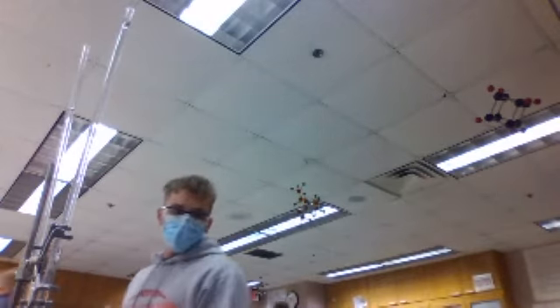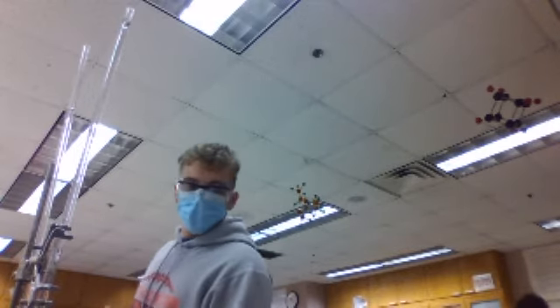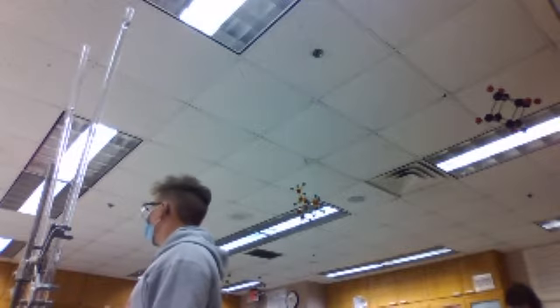That's why we use these. That's why they cost $120, guys. You can't tell me you're at 0 or 1. You have to tell me 1.12 or something. We paid $120 for this apparatus. We're wasting the money here if you guys are just going to say 1.